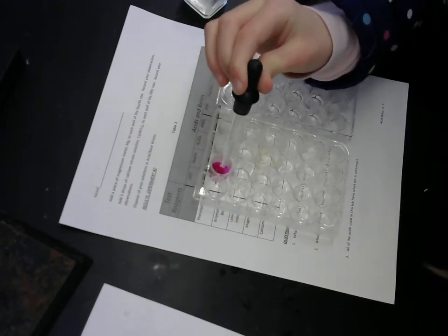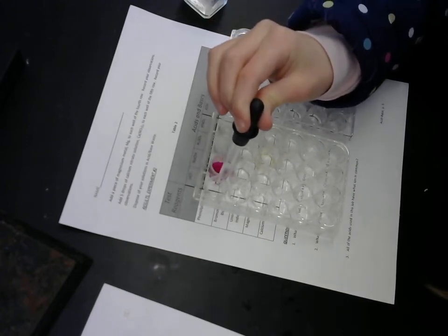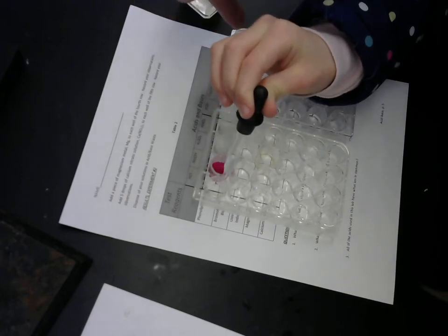Whoa. Okay. And then the top of this other set.